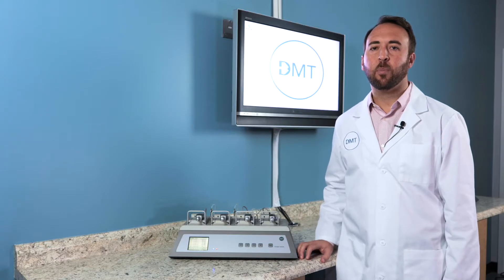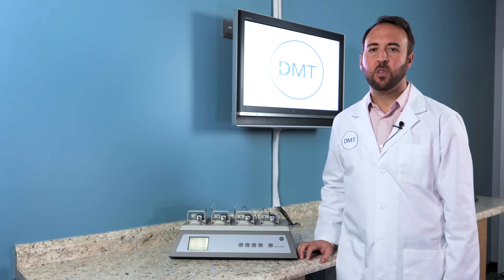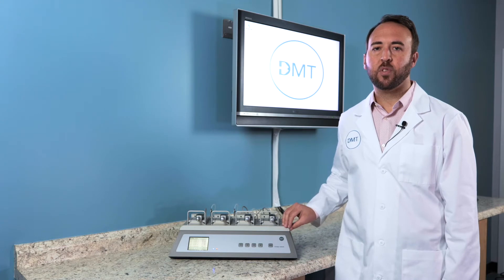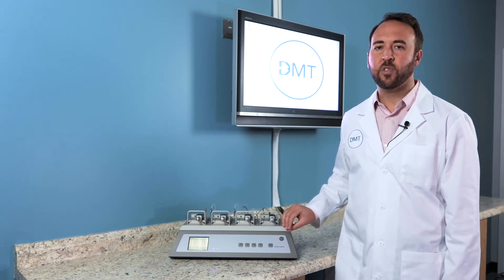You will want to use the same buffer that you will use during your experiments and you will want the same volume in your chambers that you will have during your studies.